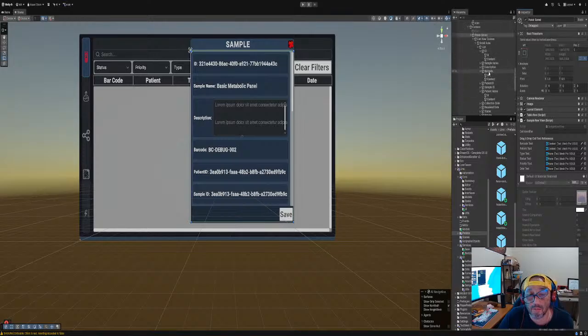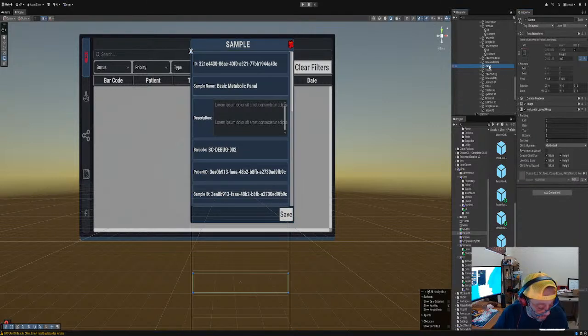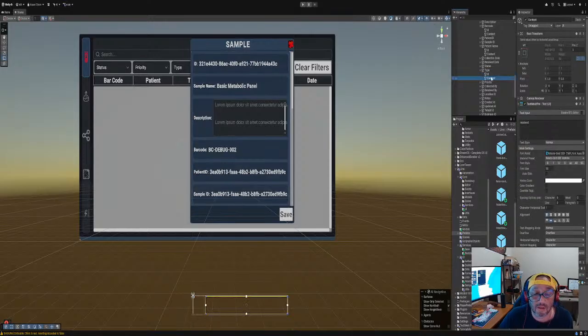List sample name. Oh yeah, that's what it is. Sample name, sample ID. No type. I forgot to put in a type in there. All right, so we'll do this. On the status, we put in type, and then we'll do ID, content, and that's good.